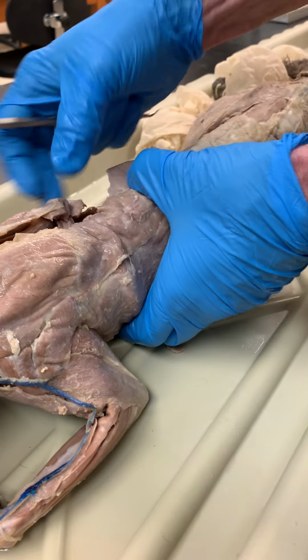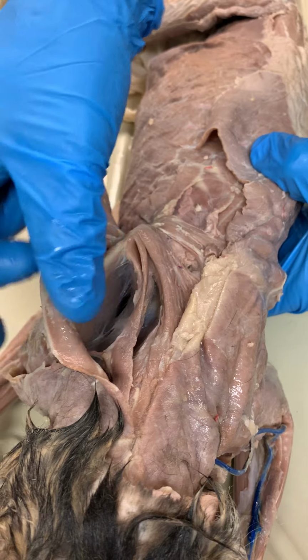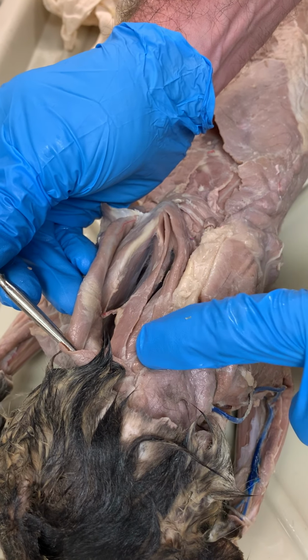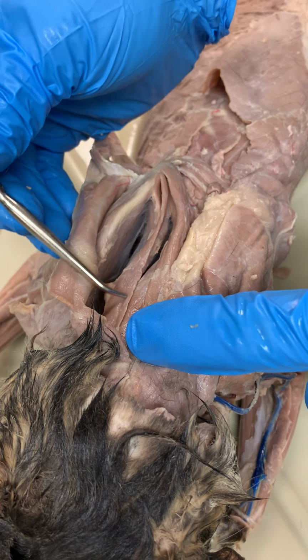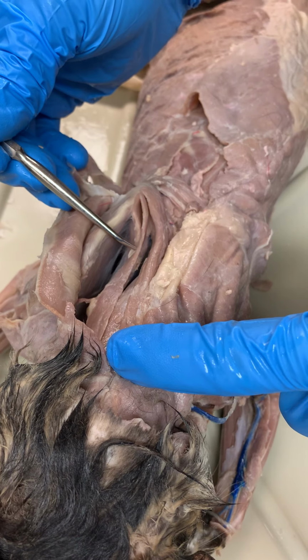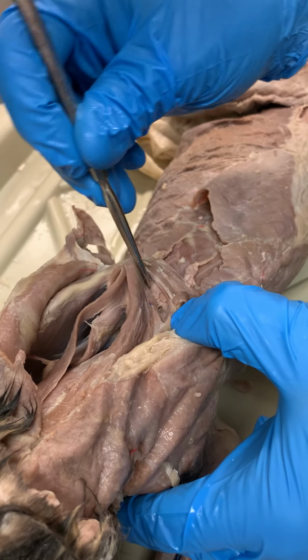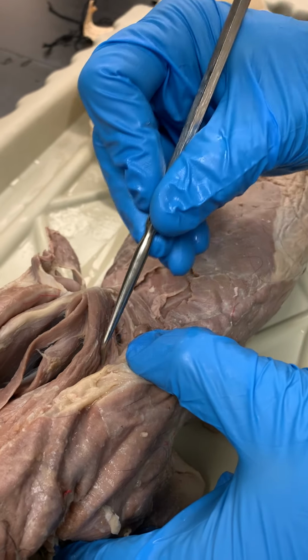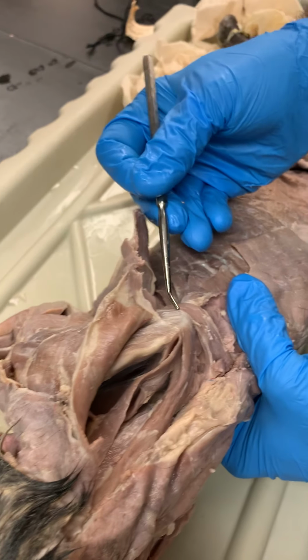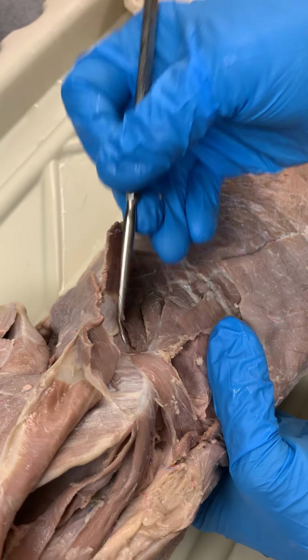Going deep, a lot of muscles to see going deep here. Beginning on the neck area, we have this deep muscle, which will be splenius capitis. The strap-like muscle coming down off the scapula is our rhomboideus capitis, also called occipitoscapularis. Here we have our rhomboideus minor, and a pretty nice division here between our rhomboideus minor and our rhomboideus major, which you will also see on the margin of the scapula, if you happen to have a view of this.